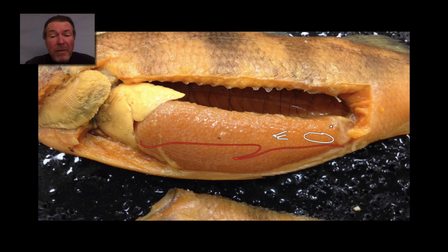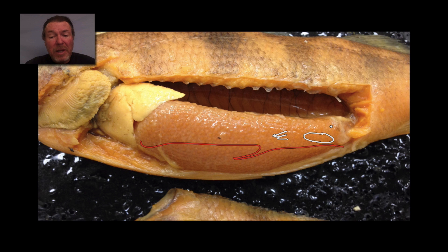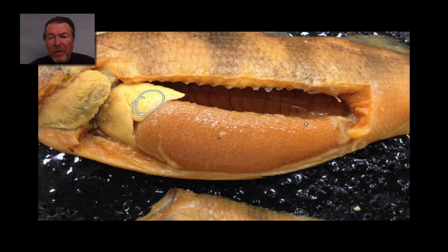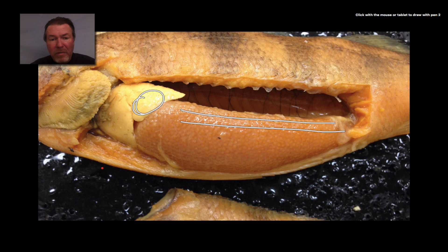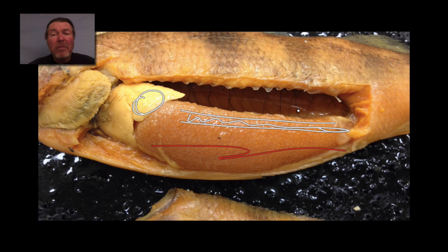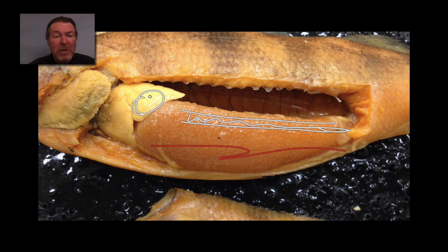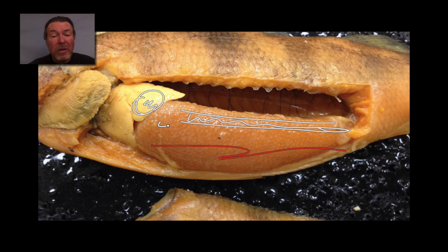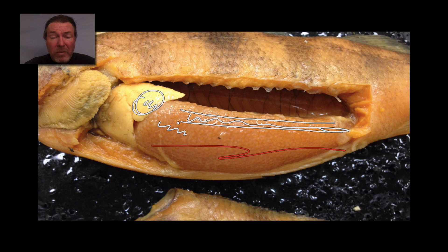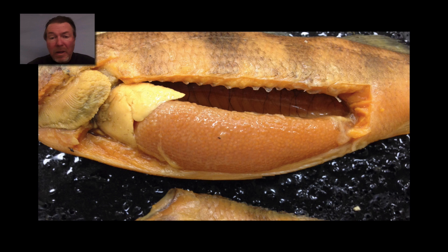If your fish has a light cream-colored or almost white band going along the back area — much lighter than the kidney and definitely not the tan color of the ovary — those would be the testes, making it a male. The testes produce sperm. In class I'll come around to each group to identify whether you have a male or female fish and answer any questions you have.